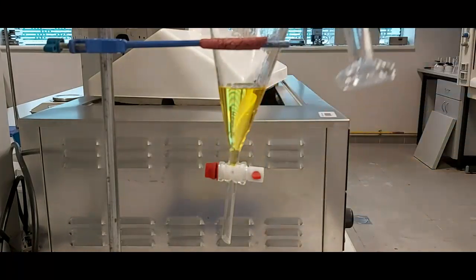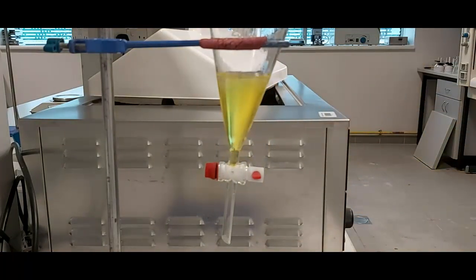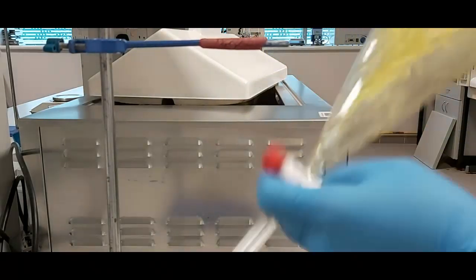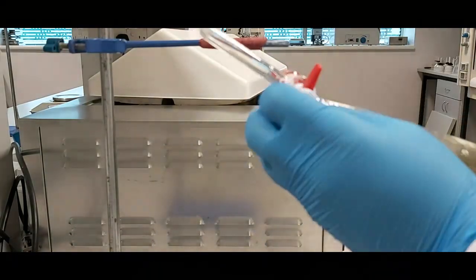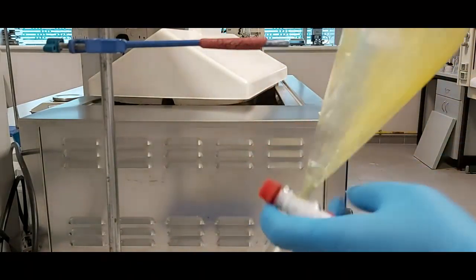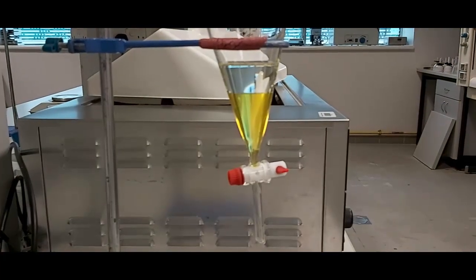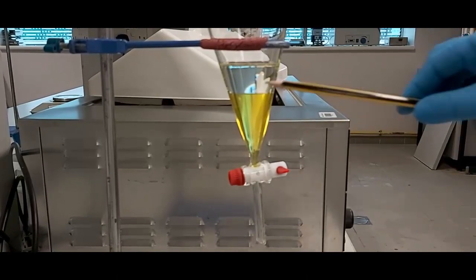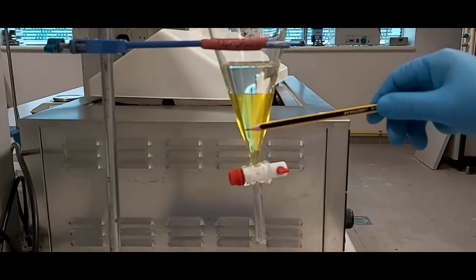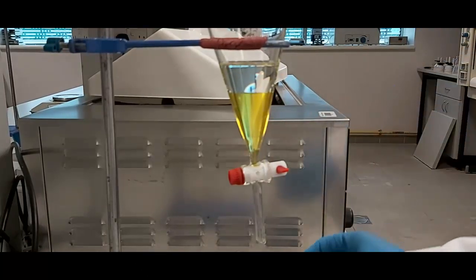I add 20 ml of ether and perform the extraction again. It is clear now — two phases again. We have the ether phase and the water phase. I separate the water from the ether for the second time.